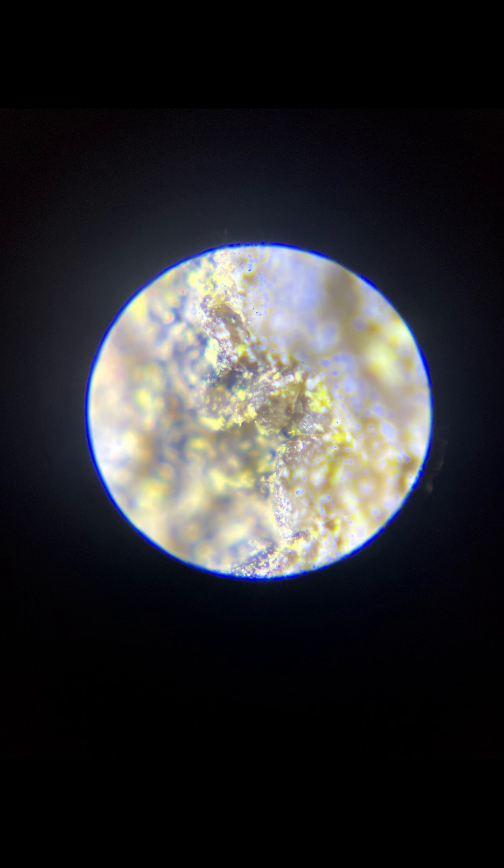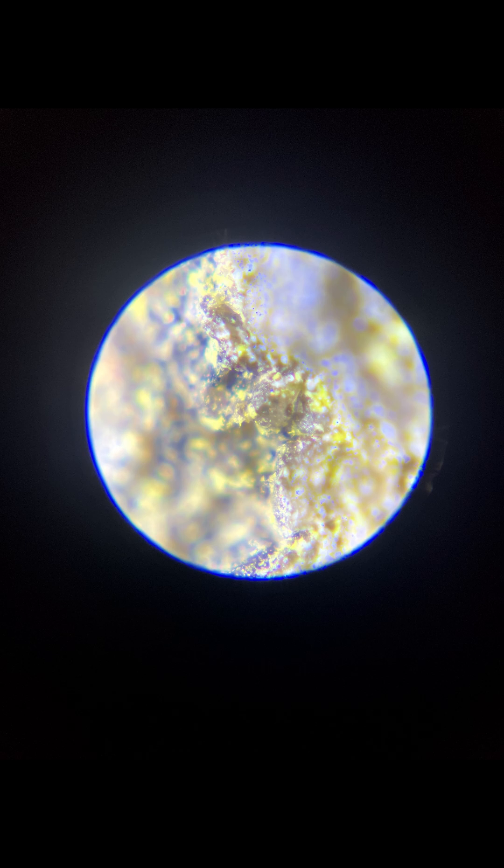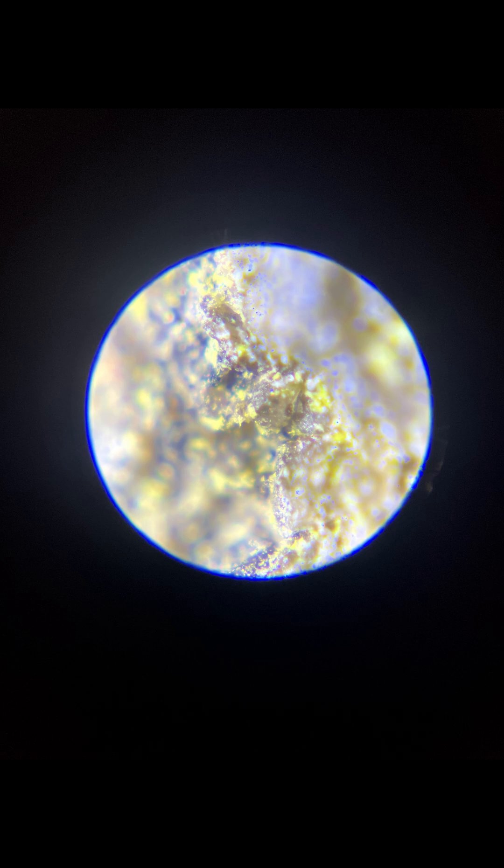So I opened up my bottle and started taking a look at some of the rocks. This one right here is a sedimentary rock with, I believe, some carnotite on it. Carnotite is a pretty complicated uranium salt — it is a potassium uranium vanadate compound. It's weird, but it looks really cool under the microscope. So this is just one of the things that I found.